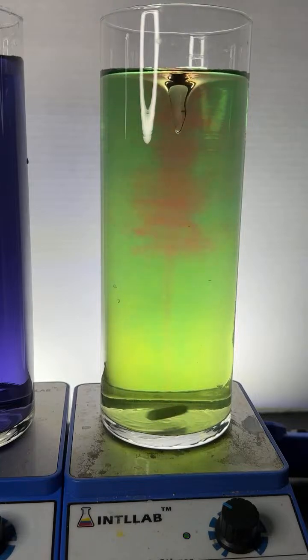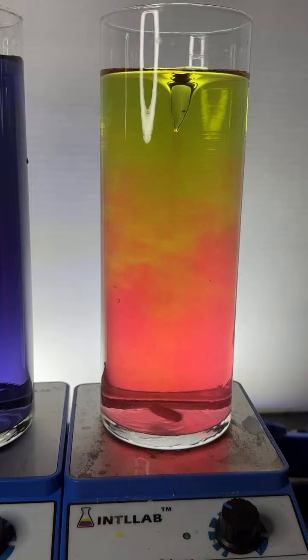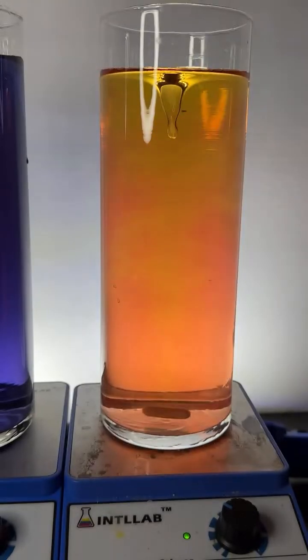That's just ridiculous. So I think you're asking if these burn. Yeah, I mean, these will burn your skin. So 20% by weight sodium hydroxide will burn your skin. I'm not going to repeat it, Gigabean. And the 20% by weight hydrochloric acid will also burn your skin.